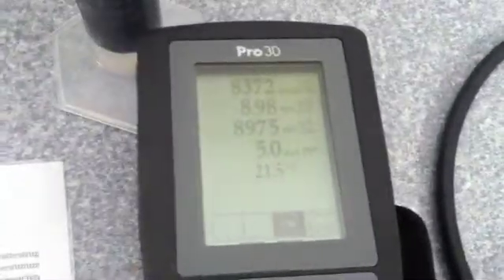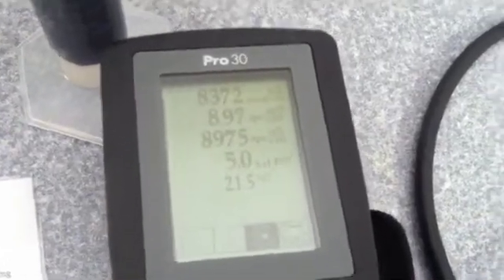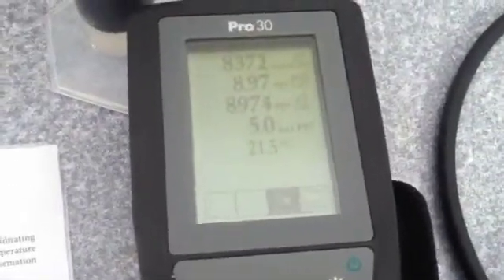YSI recommends calibrating in specific conductance just for ease of use and accuracy, and that's what we're going to do. We're going to hit hold and press the calibrate button and calibrate in specific conductance, which is independent of temperature, in microsiemens so it matches our conductivity standard.